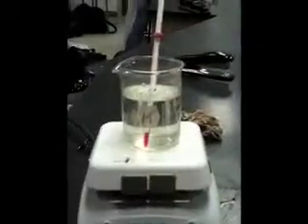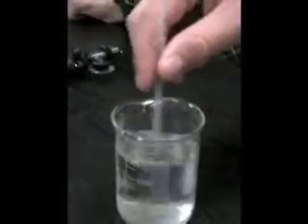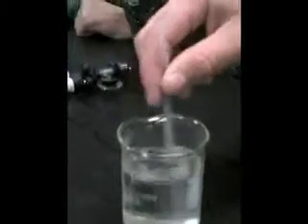Now heating the water to 65 degrees Celsius. Now we have to swirl the upside down pipette in the hot water for 1 minute. There were 18 drops drawn in at 65.9 degrees Celsius.